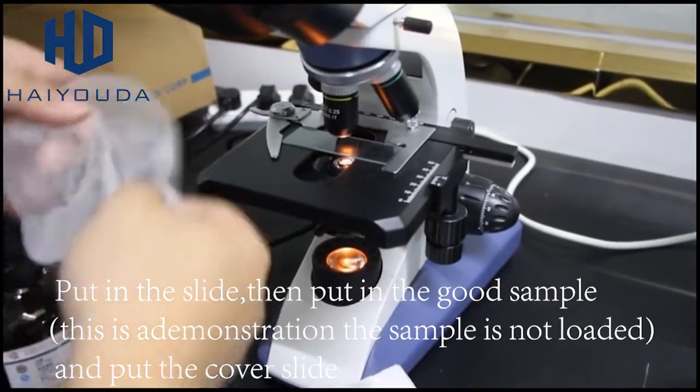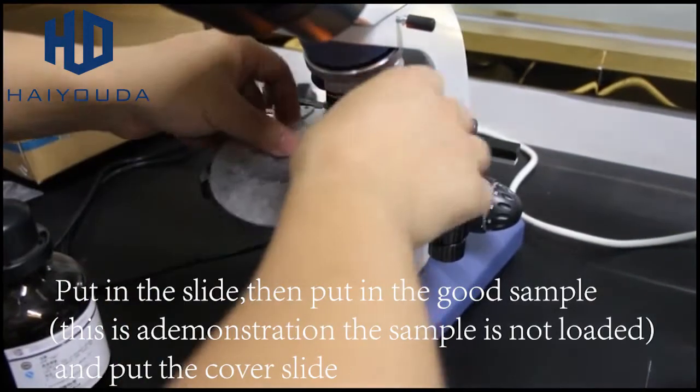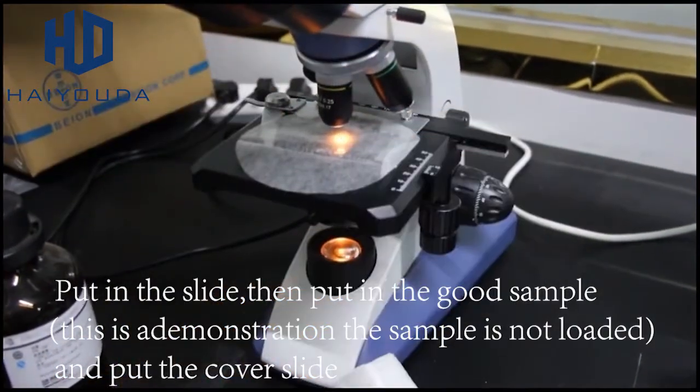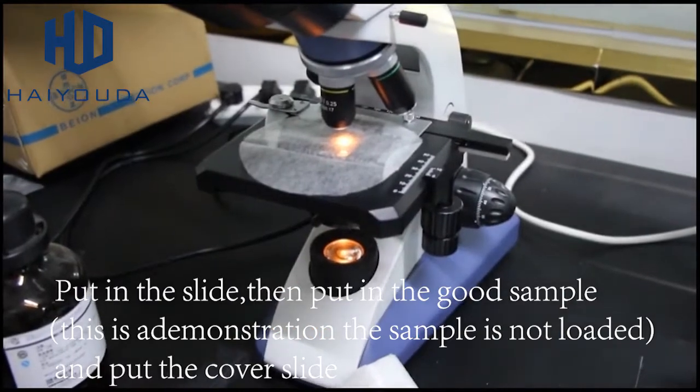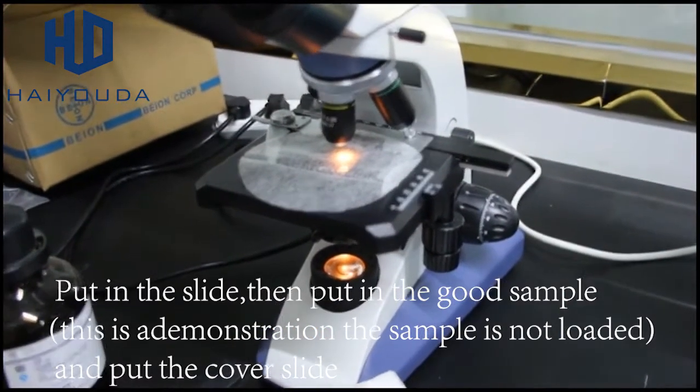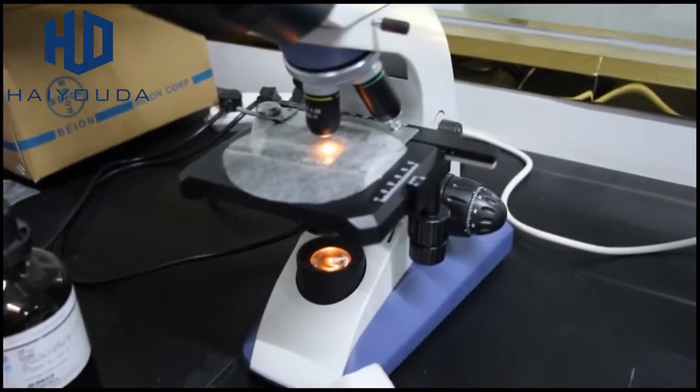Put in the slide, then put in the good sample. This is a demonstration — the sample is not loaded. Put the cover slide.